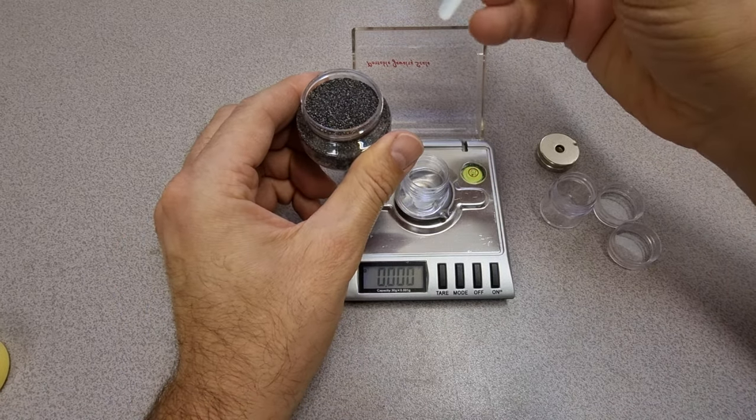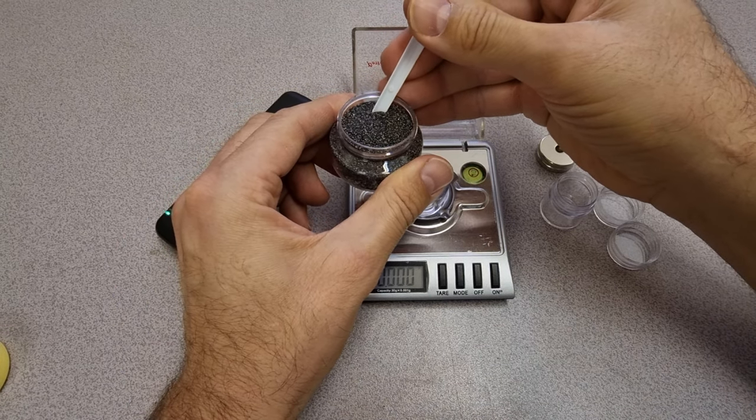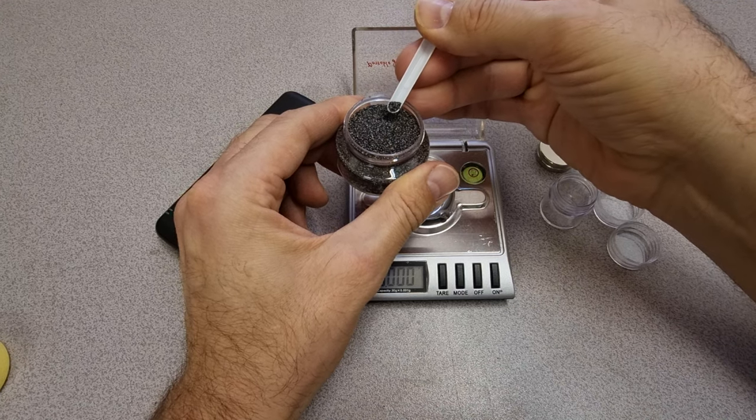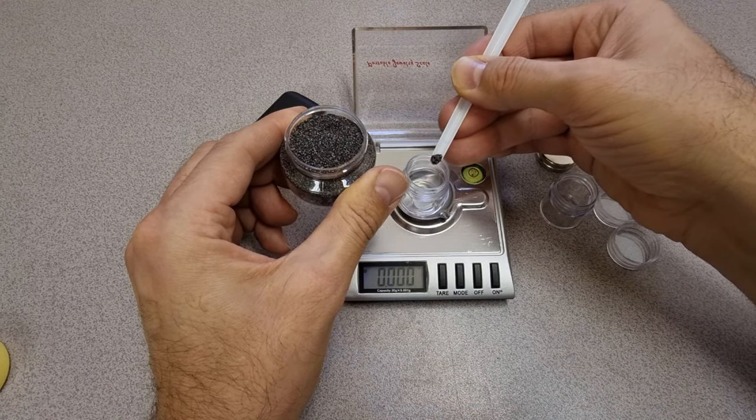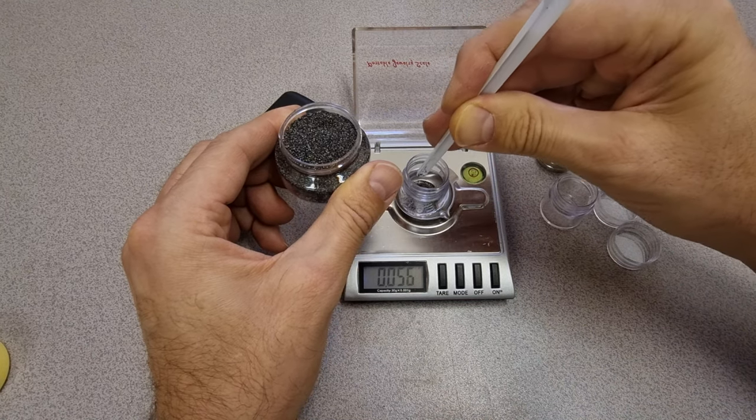I just need a few grains really, but I'm going to take a little bit enough so that we can get a measurable amount. There we go.